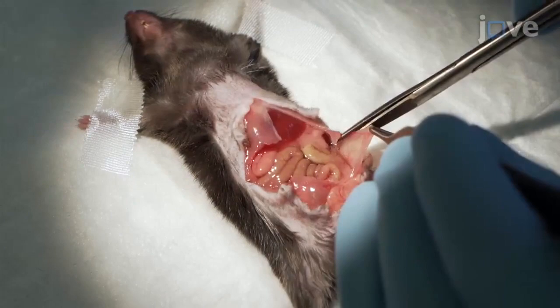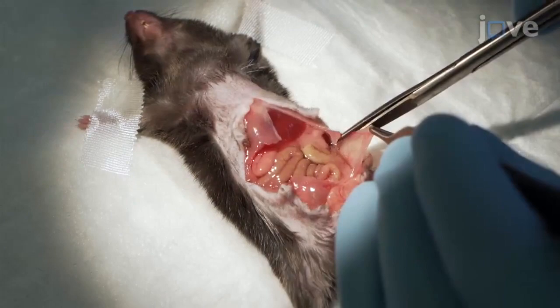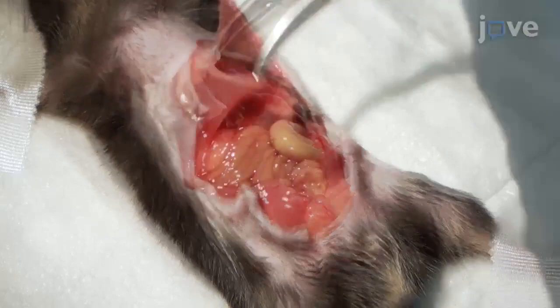Use scissors and forceps to divide the muscles into four quadrants and use two surgical clamps to secure the upper two quadrants towards the neck of the animal.